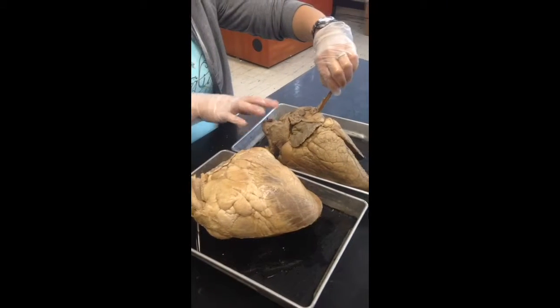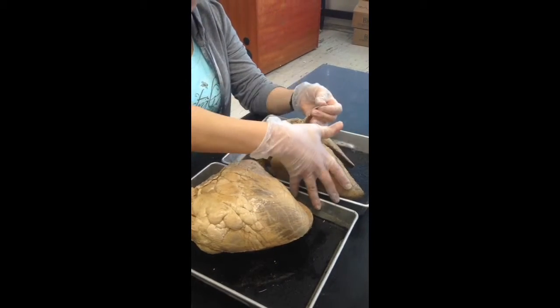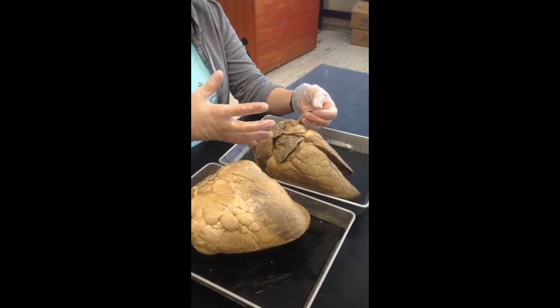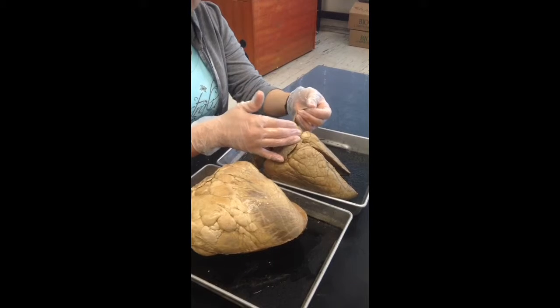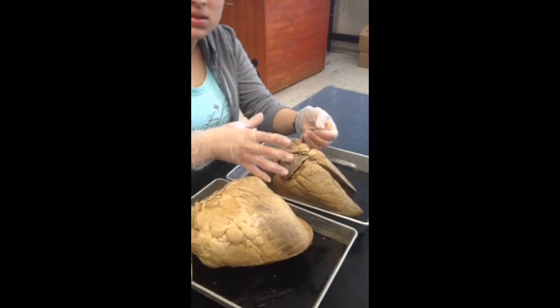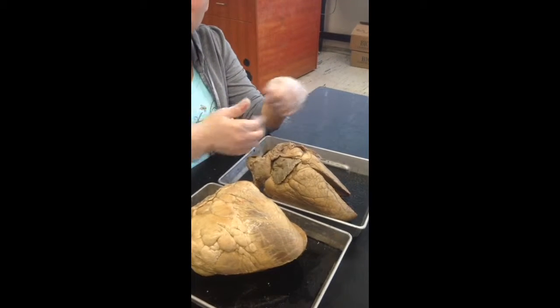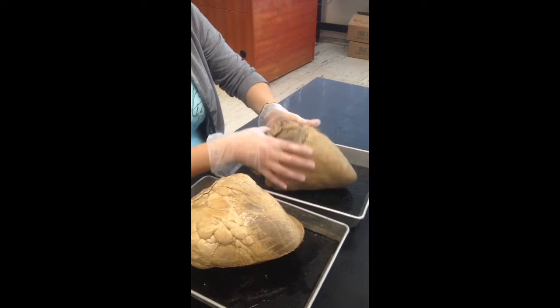pericardial sac. Most of it is taken off, but that surrounds the heart, and between the pericardial sac and the heart is serous fluid, and you need fluid. You don't need too much fluid because then you get congestive heart failure, but you need a little bit of fluid in there. I don't know the correct volume, but you do need some so that when the heart beats, it decreases friction and the heart and the lungs don't rub together too much. Alright, but this is the pericardial sac that surrounds the heart.